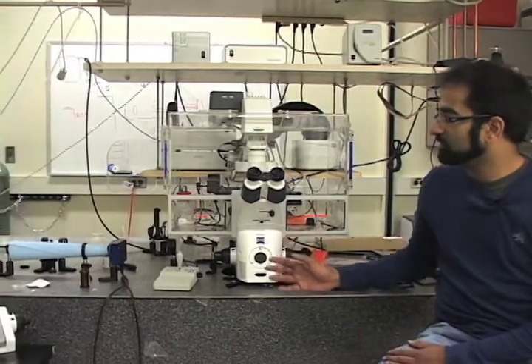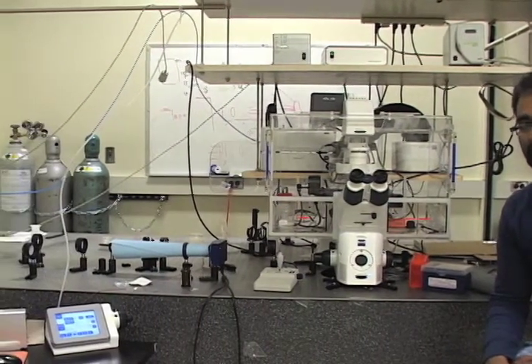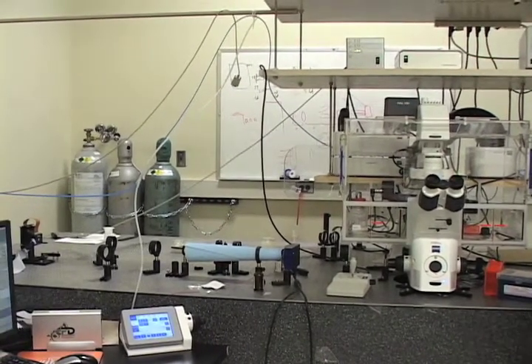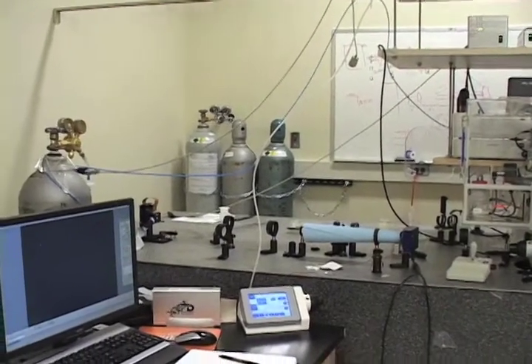I hope that after watching this video, you have a better idea of what the actual physical SLIM system looks like, and what is required in terms of space and optical components to build a SLIM system of your own. And you've heard in lecture of the theory behind the system and the various applications.